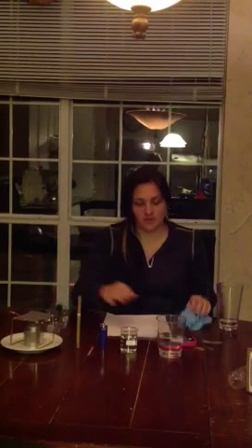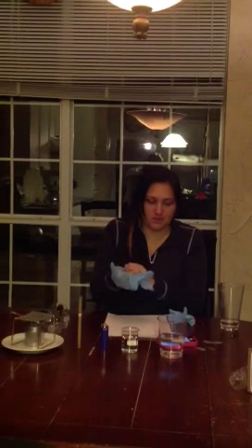Then the third thing that we need is a burner stand, which we also have right here. Burner fuel and a glass thermometer. So we have all of those items set up right here. And then we've also placed this burner stand and the wick on top of another plate just to be safe. And as I'm reminded of safety, I also have my goggles and my gloves. So I'm going to put those on now so that we can start our measurements.